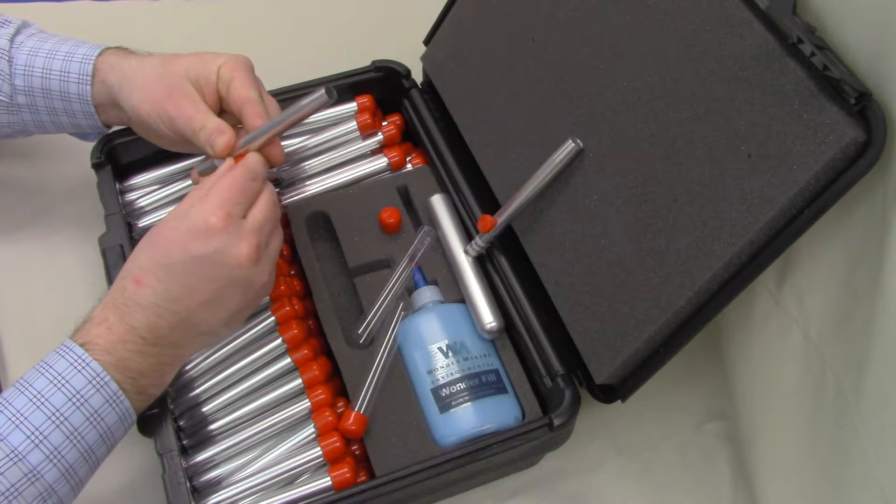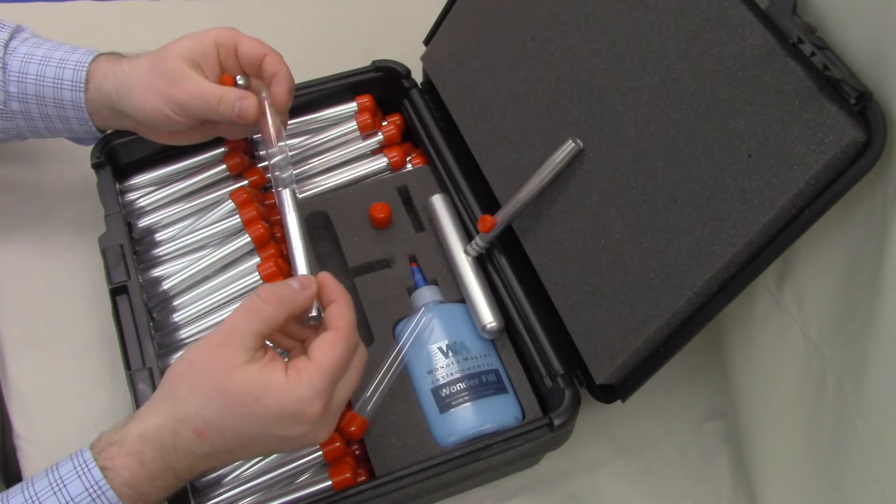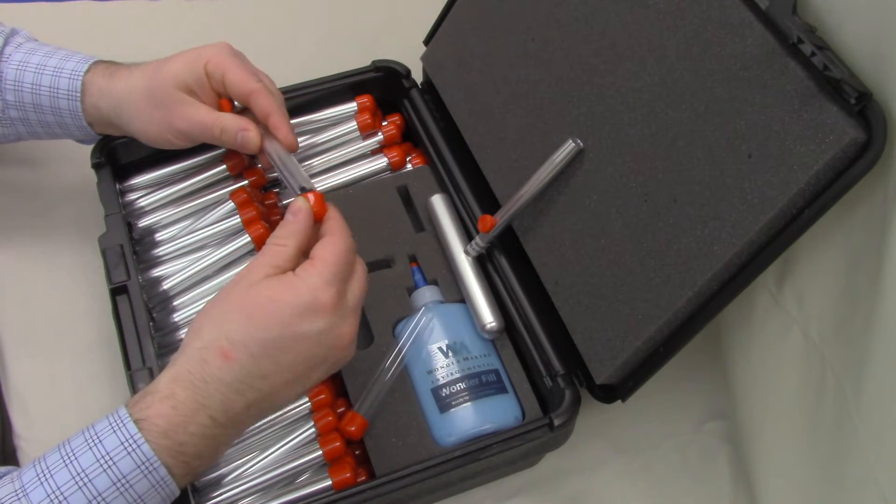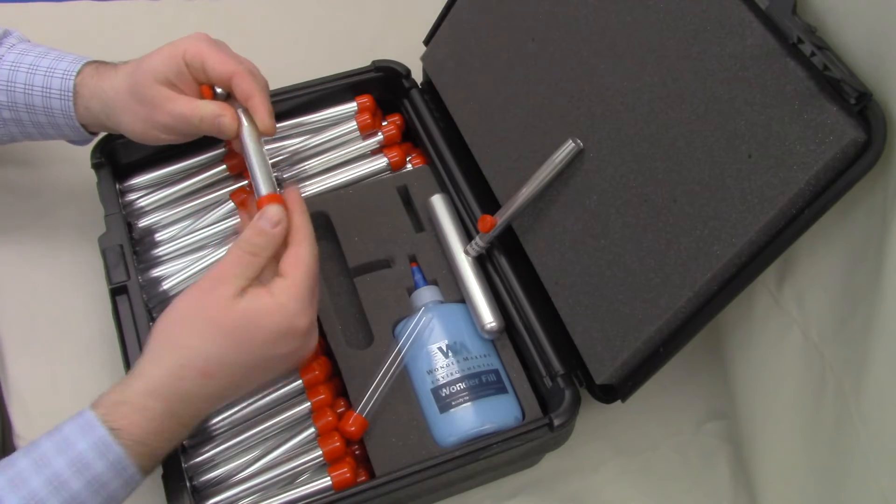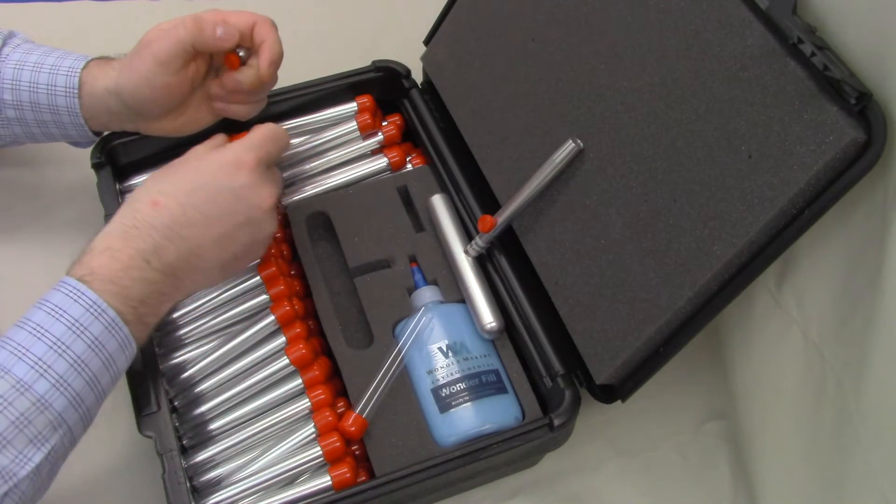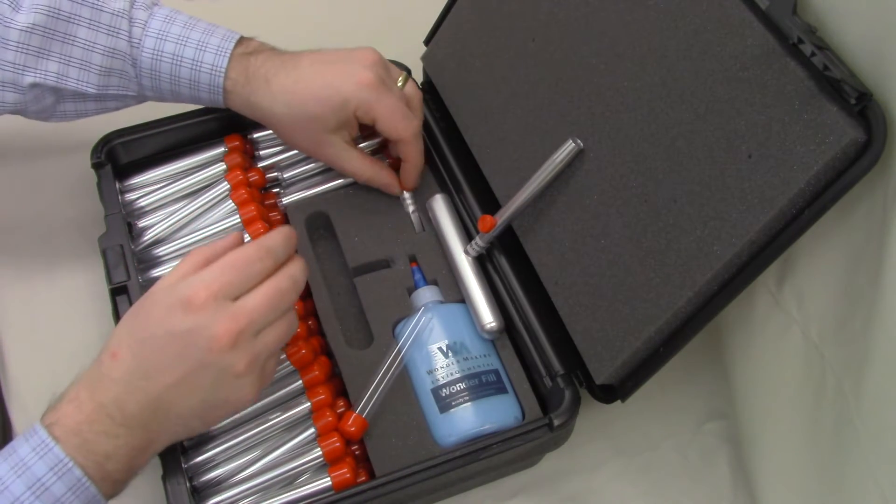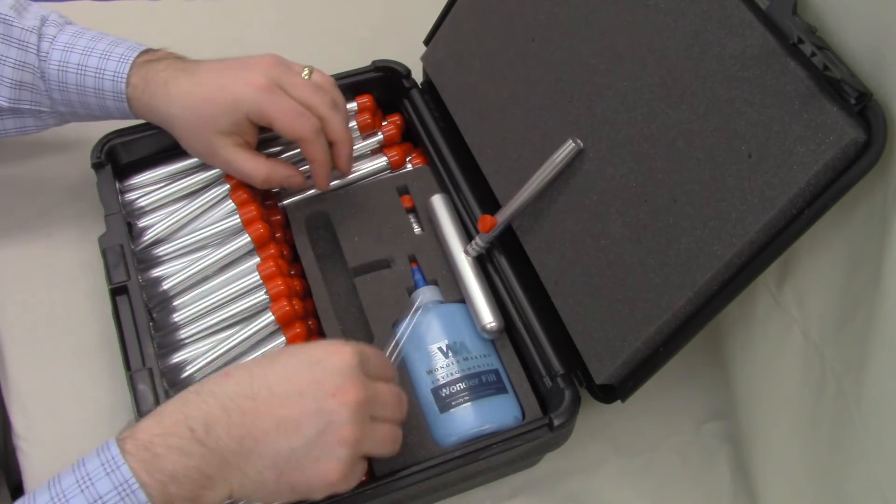We're going to take this off, put it back in the vial, and recap it. Sometimes a little bit of rotation helps that cap slide on there more easily. I'm going to put the T-handle back in the case, and we're going to talk about Wonderfil.